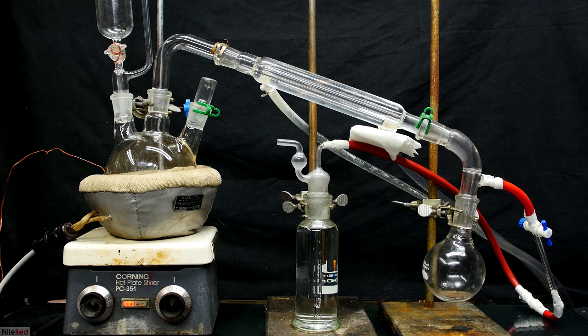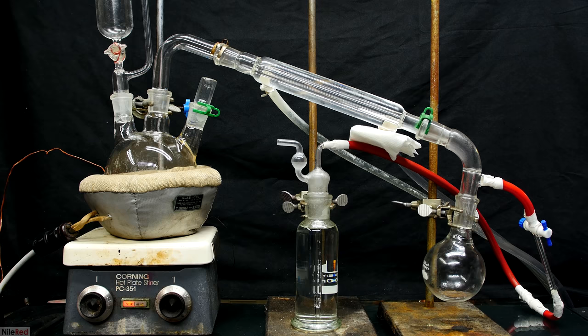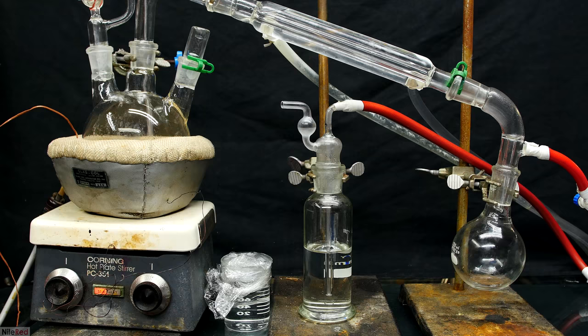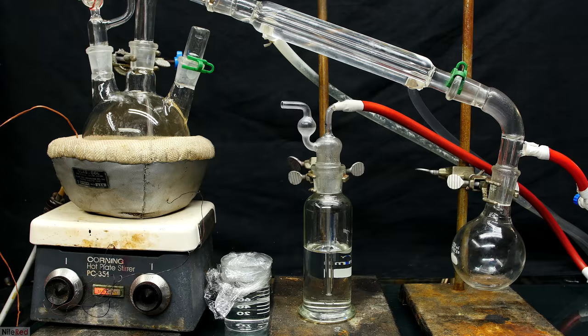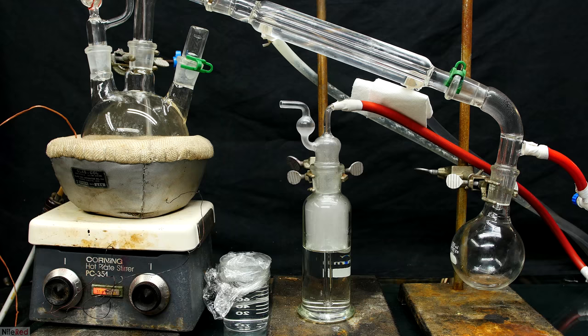Anyway, as I heat it up, it starts to bubble again, but I'm afraid that the bubbler will overflow. I close the stopcock, empty some of the solution into a beaker, and then I start things up again. A decent amount of trimethylamine does bubble out, but it doesn't last for very long.